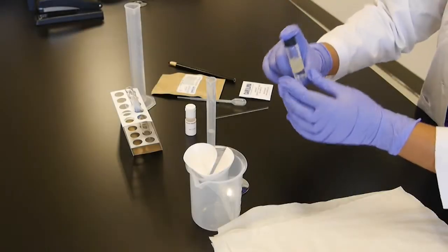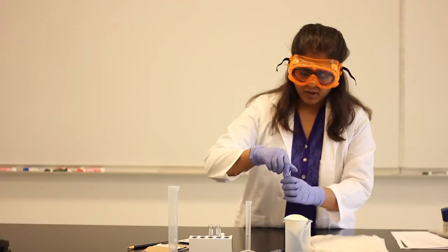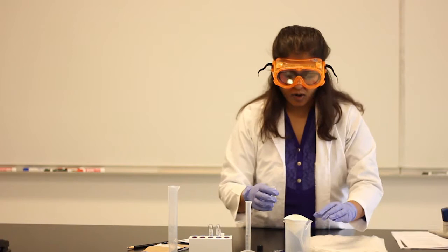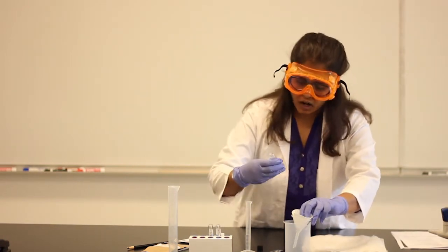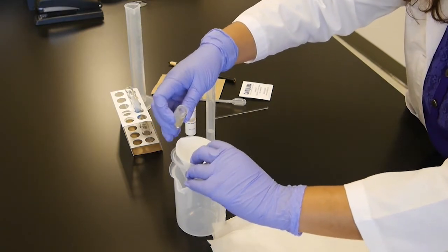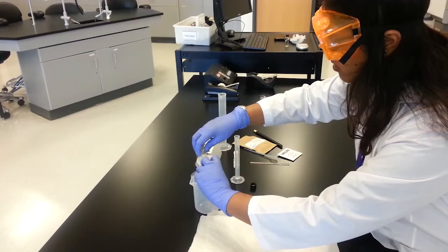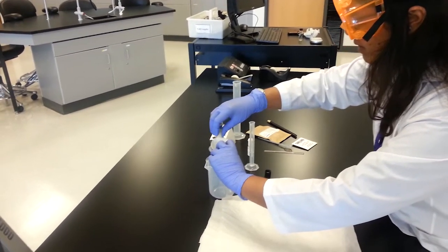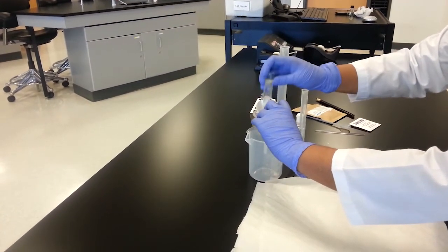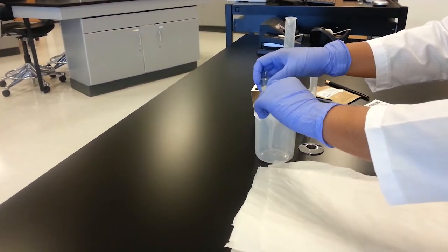So I hope after the mixing and 72 hours, let's see if the oily part you got at the top is soap or not. First of all, let's filter out this layer. So I've got a filter paper folded in a beaker. Let's pour the whole solution. See, the thick upper part came out, but not the whole thing.